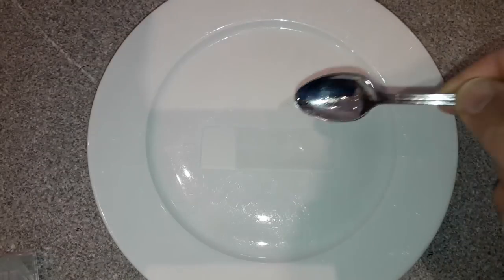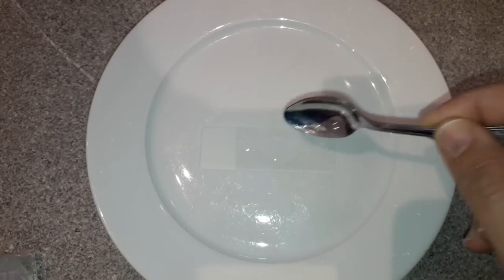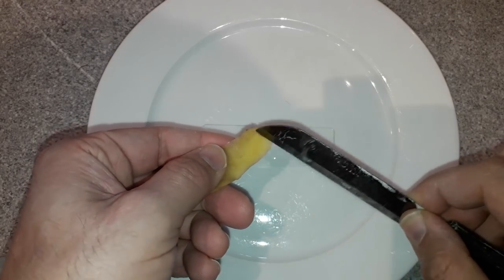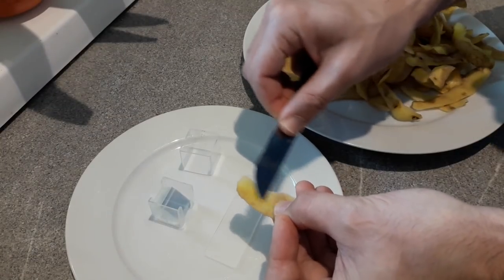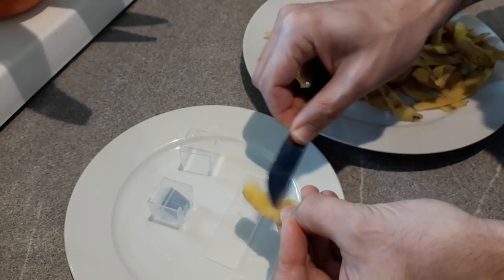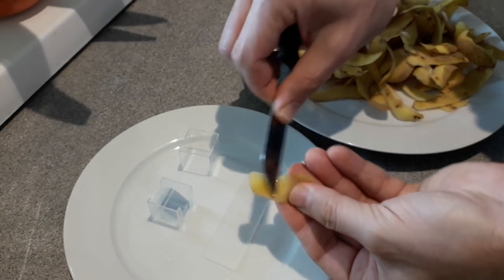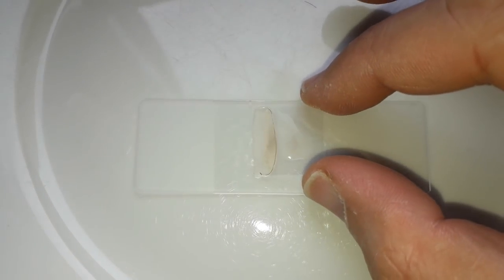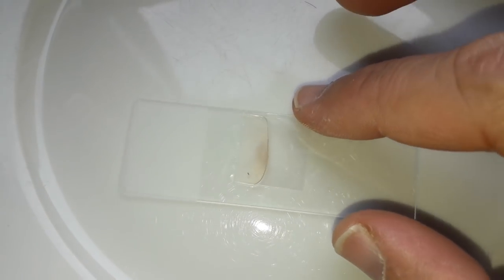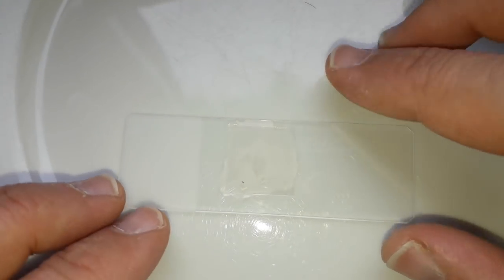Well let's start out first by putting a small drop of water on a microscope slide and then a scratch of some of the potato starch grains using a conventional kitchen knife and I transfer them on the slide and what I see it's slightly yellowish. Cover glass goes on top of it as always and we're ready to go.